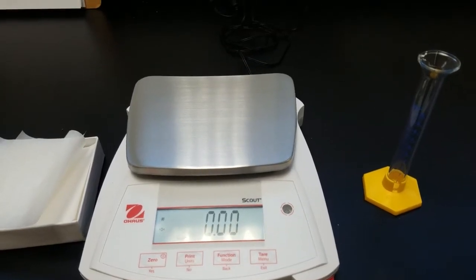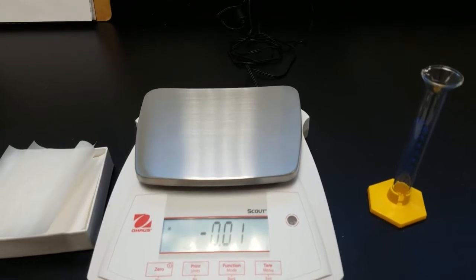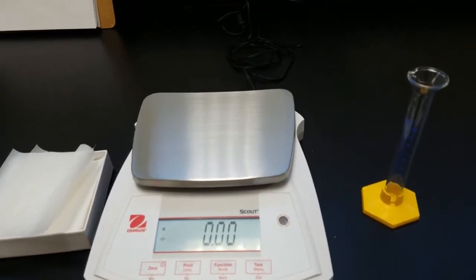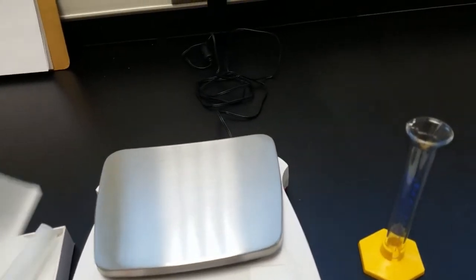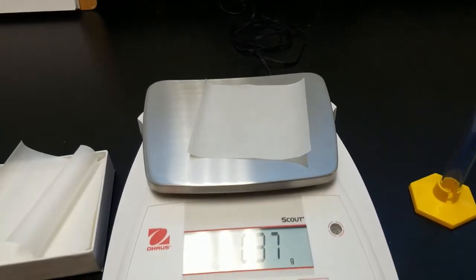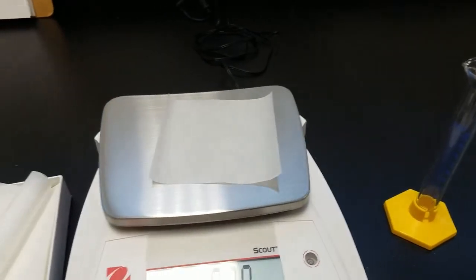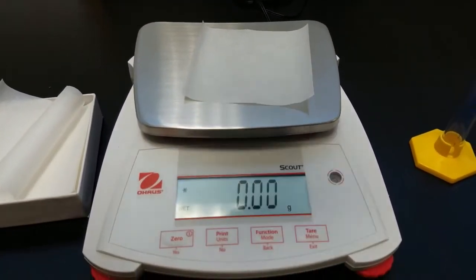To collect data for you to use in Excel, we've gotten a graduated cylinder and we're going to use the balance. To protect the balance, put a piece of weigh paper and we want to zero it out so that it says zero.